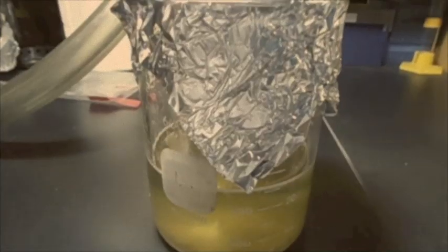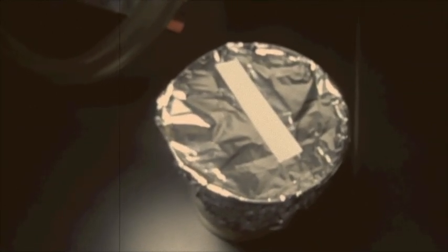Cover with foil to prevent your solution from boiling over. If you have autoclave tape, you can place the tape on the foil beaker to indicate when the solution has been sterilized.